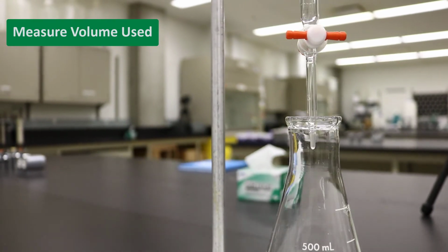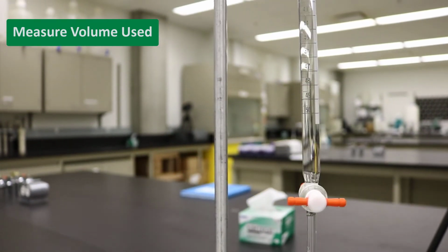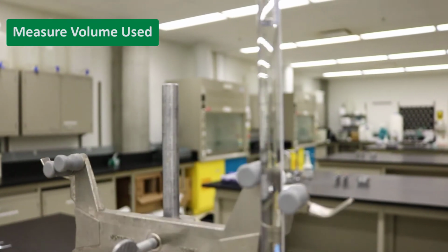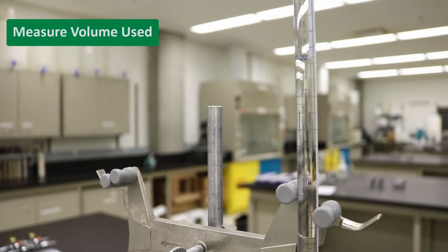Write the final volume reading. Based on the volume and concentration of titrant, you can calculate the concentration of oxygen in the water sample.